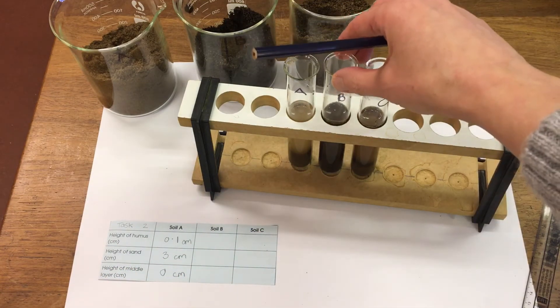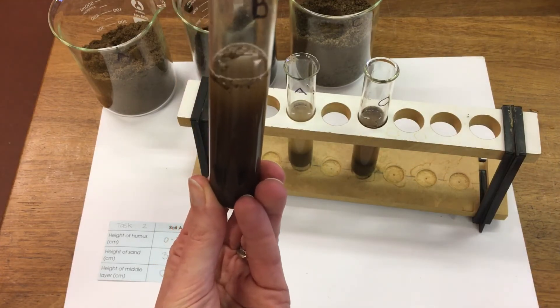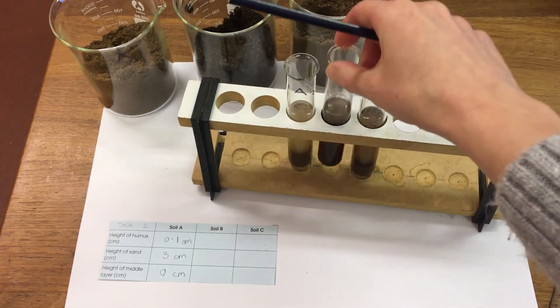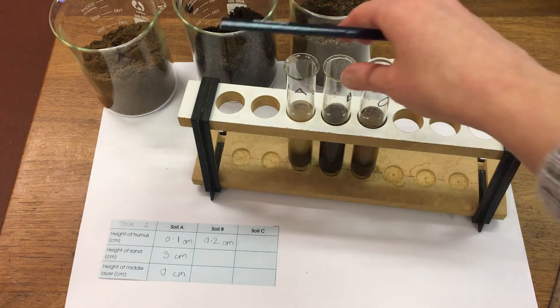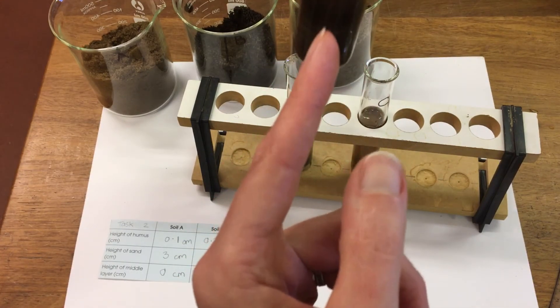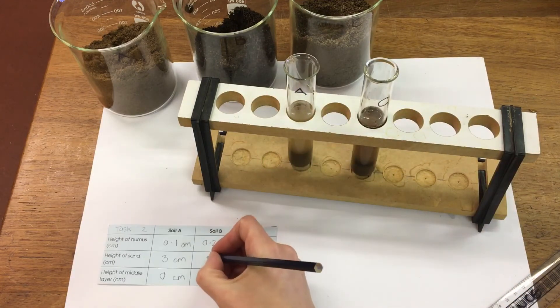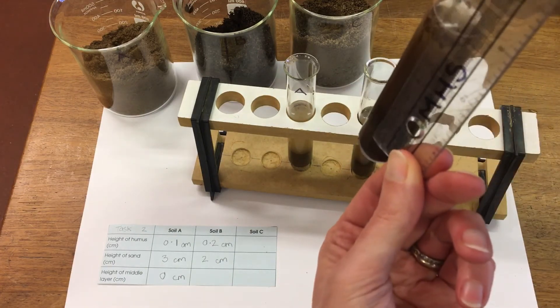So soil B, we'll have a look at this one. First of all we'll measure the height of humus at the top - that's got about 0.2 cm. And then the height of sand. We can see the sand and then we've got a middle layer. The height of sand is 2 cm, and then the middle layer in this one is 1 cm.